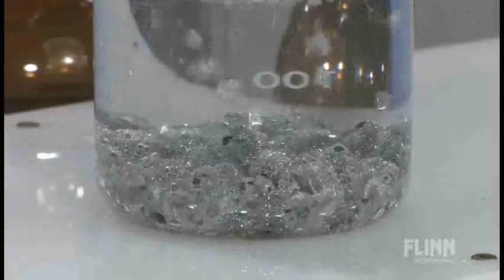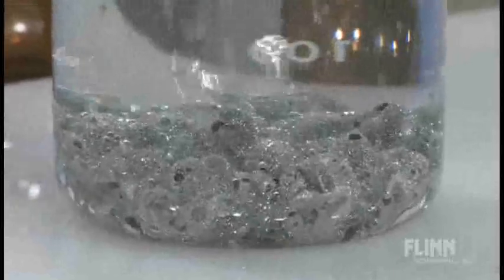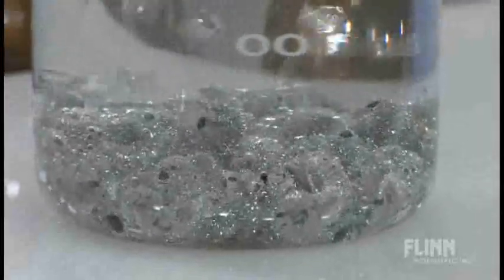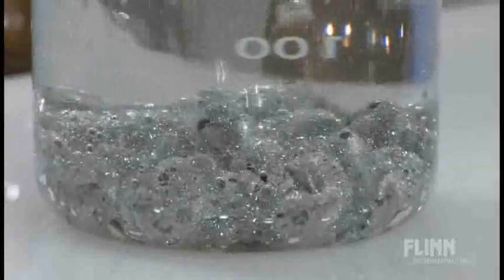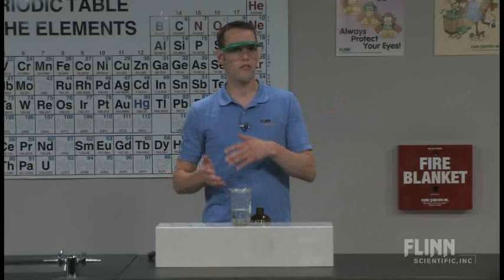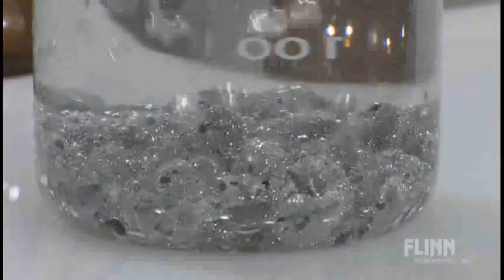So because we're getting cavities on the metal, we have spaces where hydrogen gas is being formed inside or open cavities, so we start to lower the density of this. And if you let this sit long enough, when I use this I set it up at the beginning of class, so it's running for all 45 minutes of class and then at the end we look at it. And I'm going to swap out to one that I've already prepared.